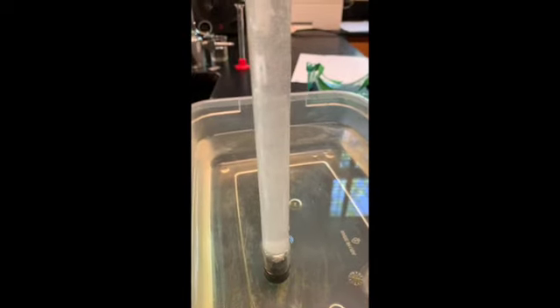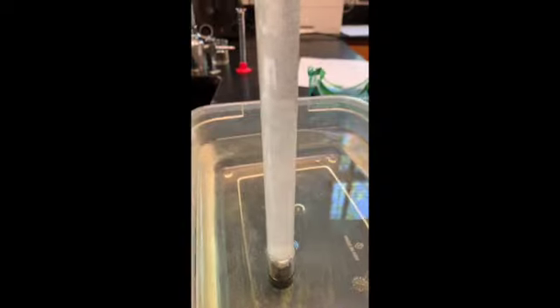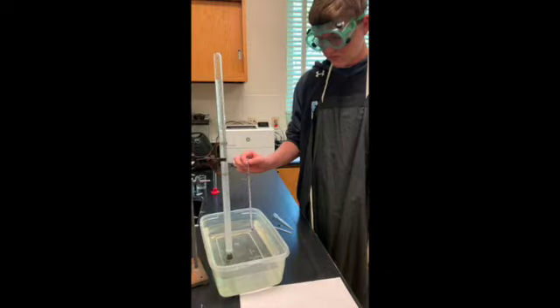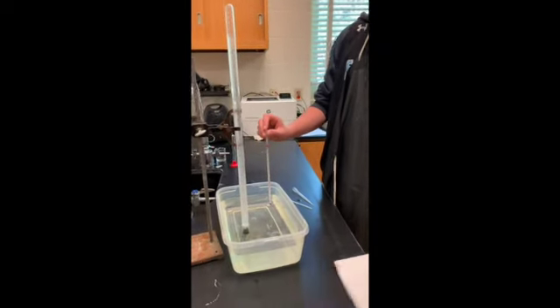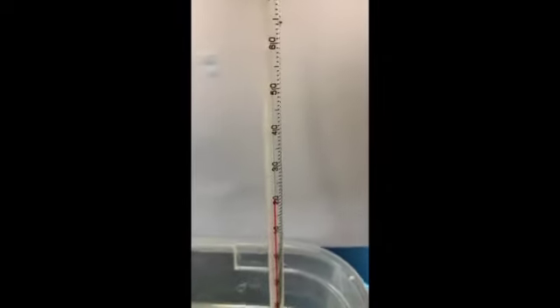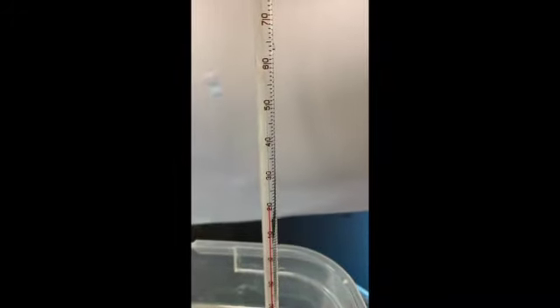All right, as you can see, we're really forming some gas bubbles now. They are starting to collect in the top of the tube. All right, so while we are still collecting our gas, Maurice is going to go ahead and take the temperature of our water inside, and I'm going to film it so you can see it. There we go, so there is our temperature in Celsius.